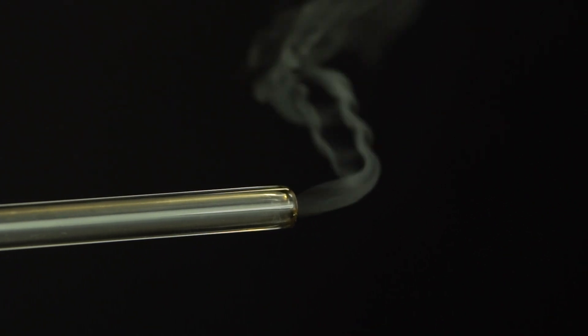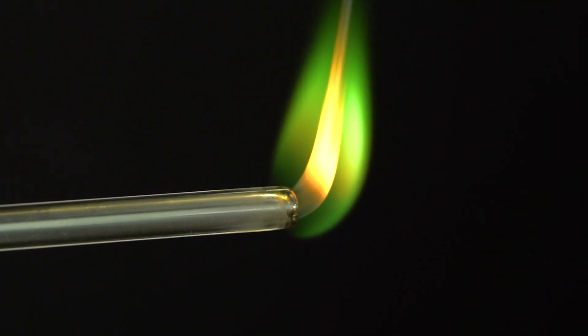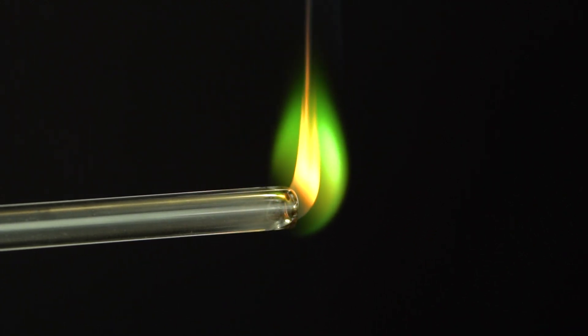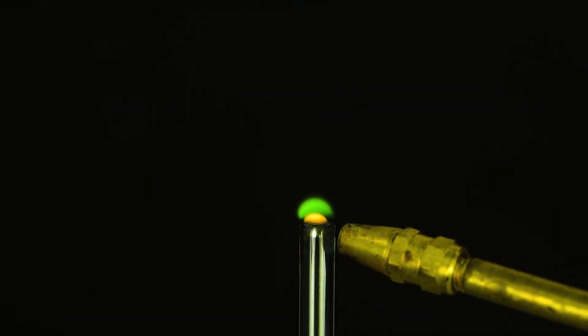If you have a gas vent installation, diborane will burn more smoothly. You can get a clear green flame by burning diborane in pure oxygen.